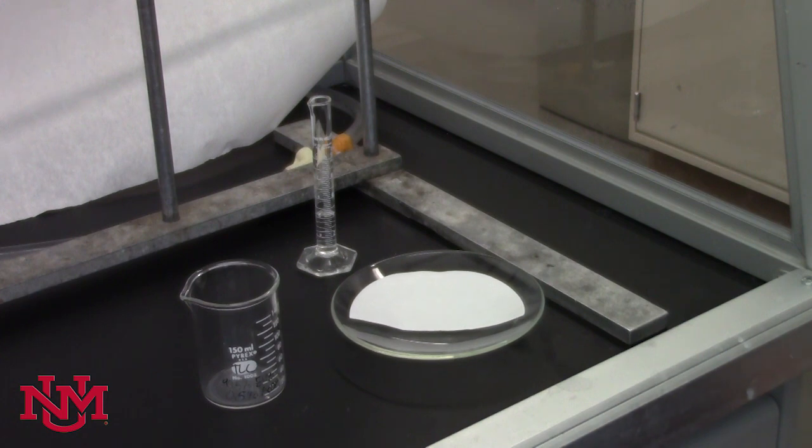TLC separates compounds based on their differing polarities. You need to have a saturated atmosphere in a sealed jar in order to do this experiment.